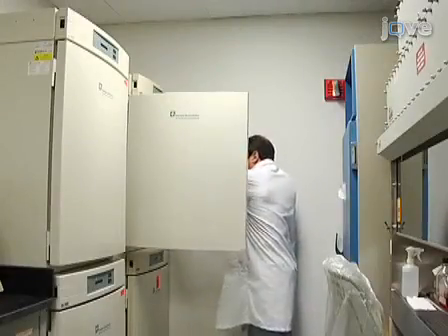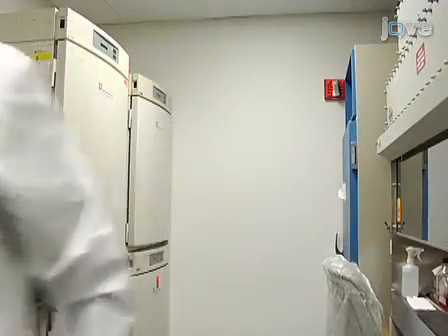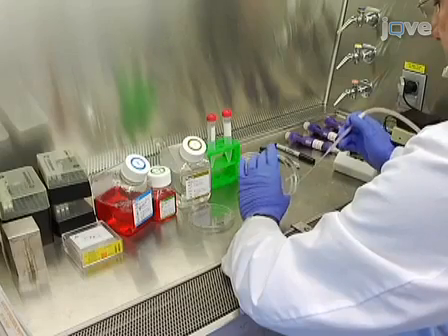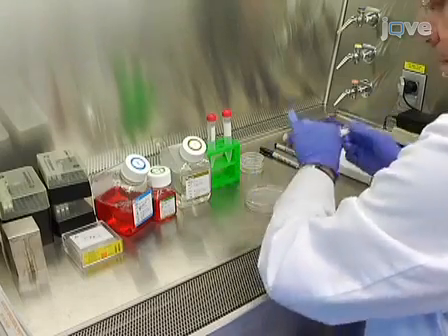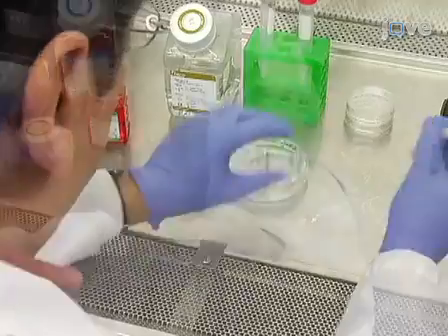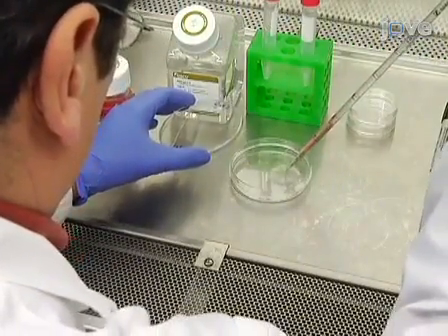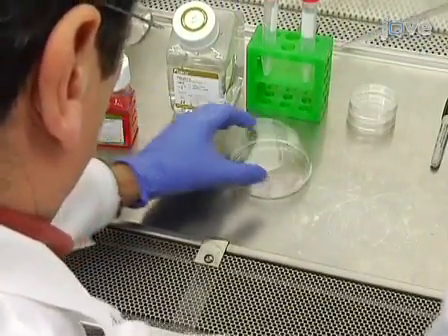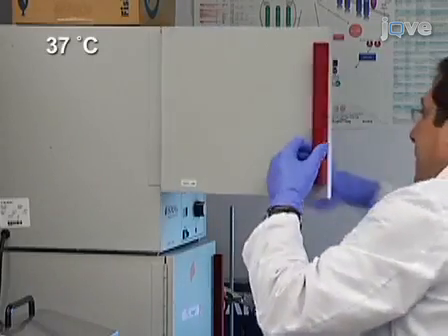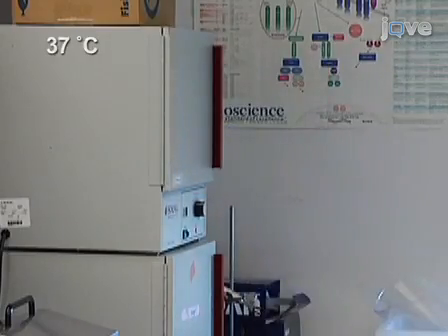To begin this experiment, harvest adherent cells at 90% confluency. First, aspirate the culture media and rinse the cell sheet twice with PBS. Then, aspirate the PBS and pipette 2ml of 0.05% trypsin EDTA solution onto the monolayer. Place the plate into the 37°C tissue culture incubator and incubate until cells detach.